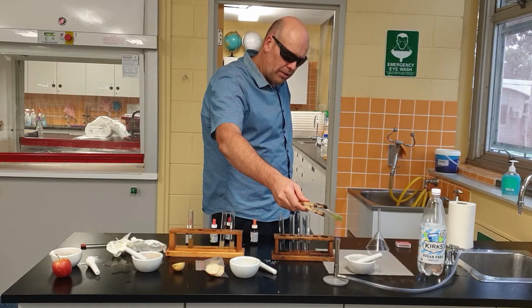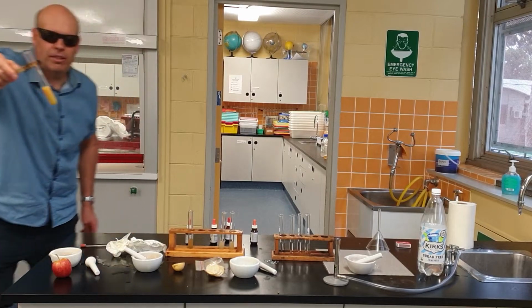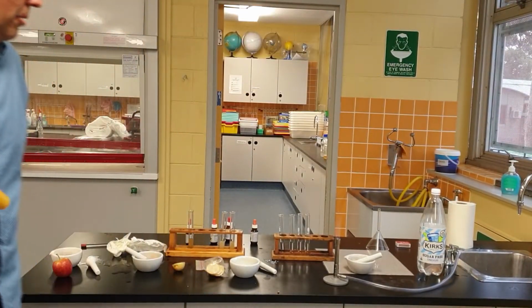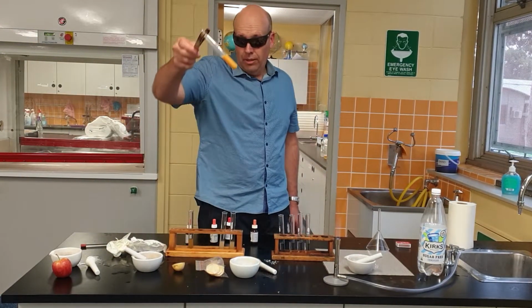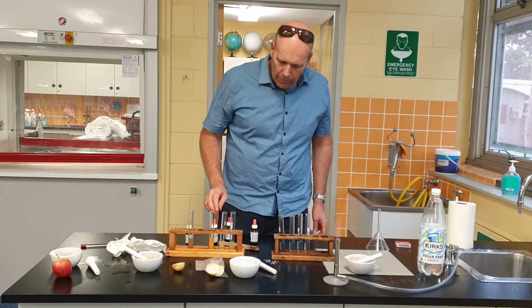Yeah, definitely. Oh, here we go. Look at this. How's that, everyone? Makes sense, doesn't it? You would think it would have to have glucose in it. Well, it absolutely does. Colour doesn't lie, does it? Colour does not lie.